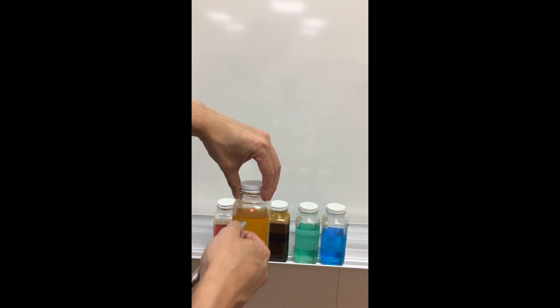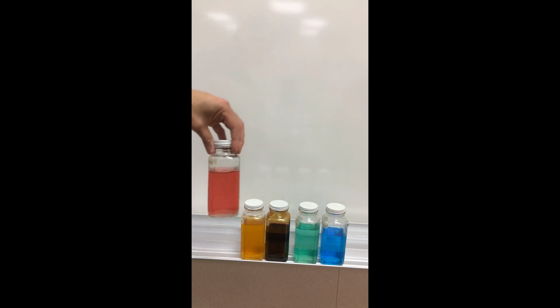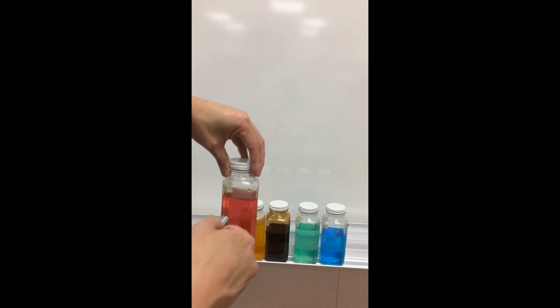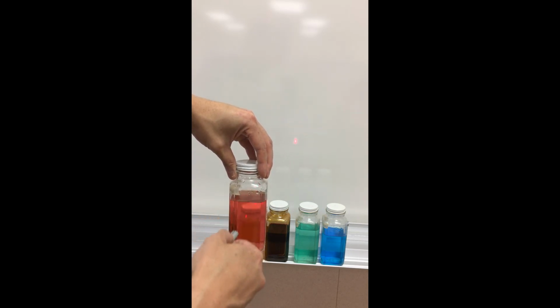Okay. And then just to verify for ourselves here, the reason why this cobalt-2 nitrate solution looks red is not because it absorbs red. If I have a red laser pointer, if it doesn't absorb red, I would expect this to go through. Let's have a look. So we have a laser pointer going through the glass here. As I go through the solution, again, no problem going through that red solution.